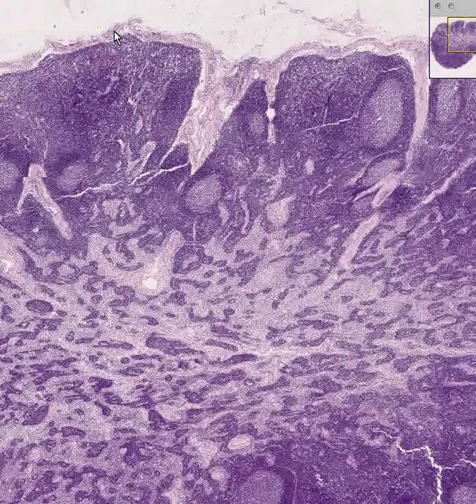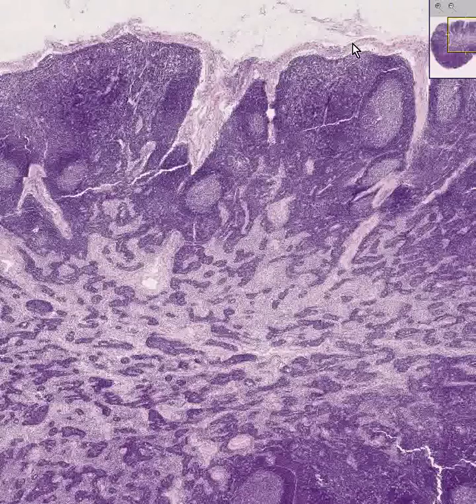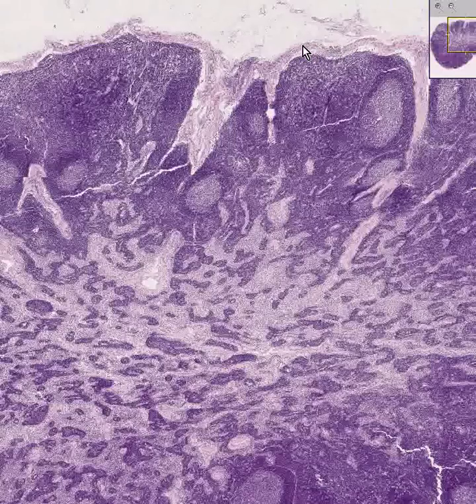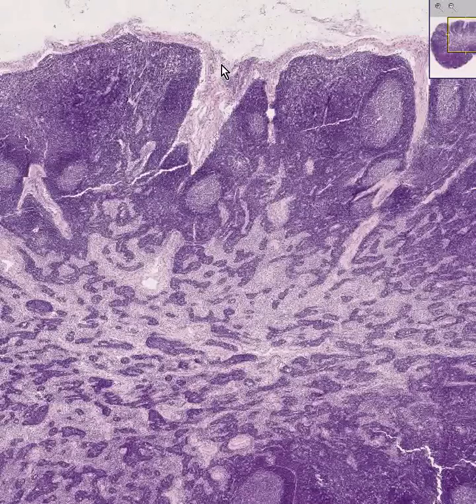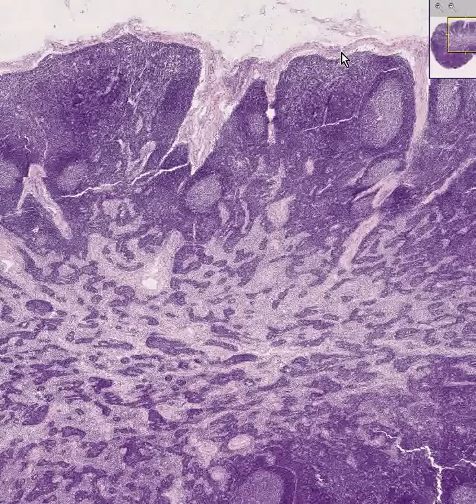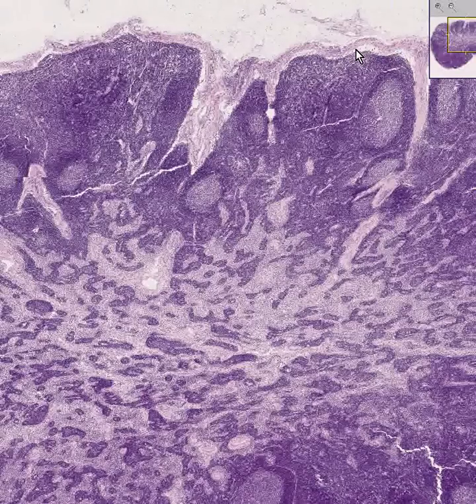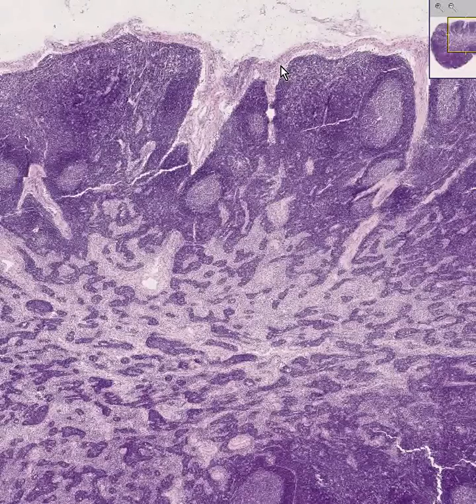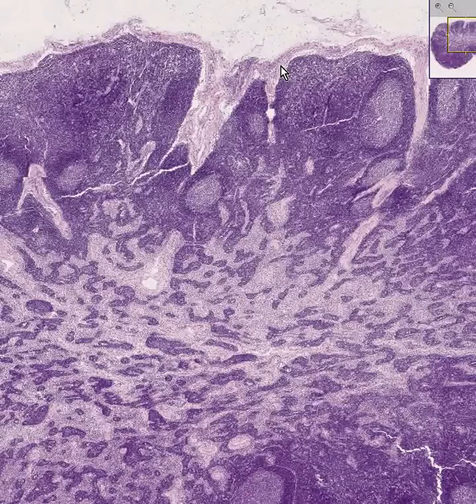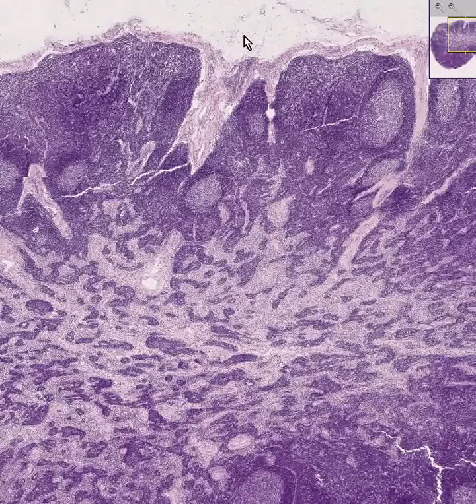First of all, it is covered by a nice thin fibrous capsule, predominantly fibroblasts and collagen. Secondly, there is a space underneath this capsule which is called a subcapsular sinus, and this is what is connected to the incoming, or afferent, lymphatics.